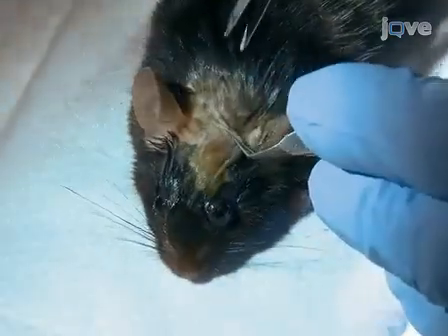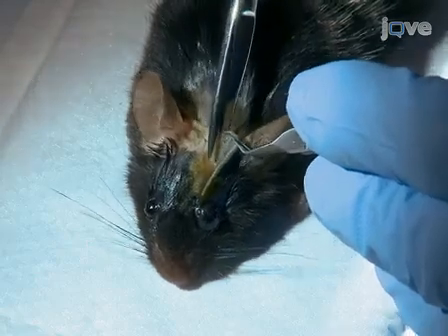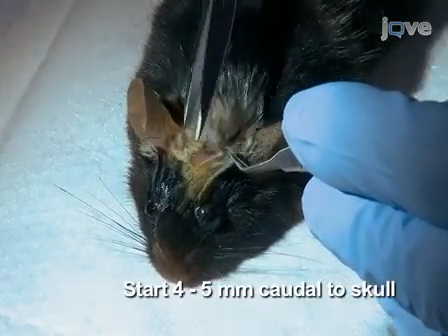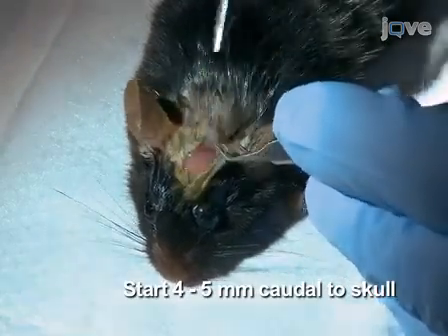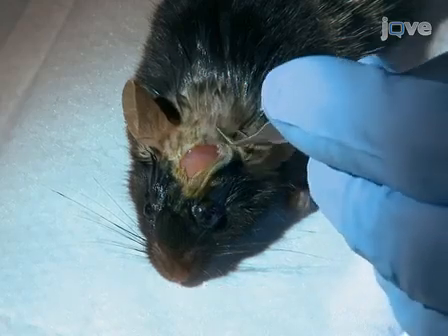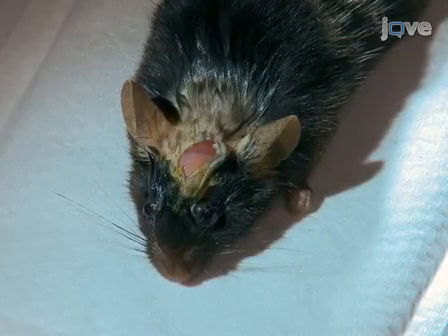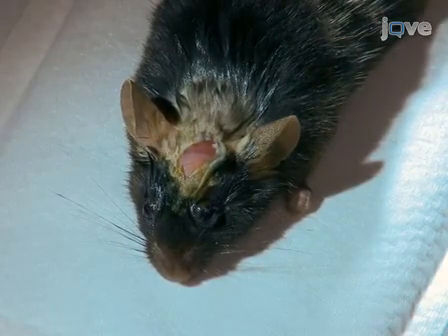Begin the surgery using small scissors to make a midline incision in the scalp, starting 4 to 5 mm caudal to the skull and advancing forward to the front of the eyes. This incision should be long enough that the skin will not interfere with the gluing of the plate that stabilizes the mouse head during two-photon imaging.